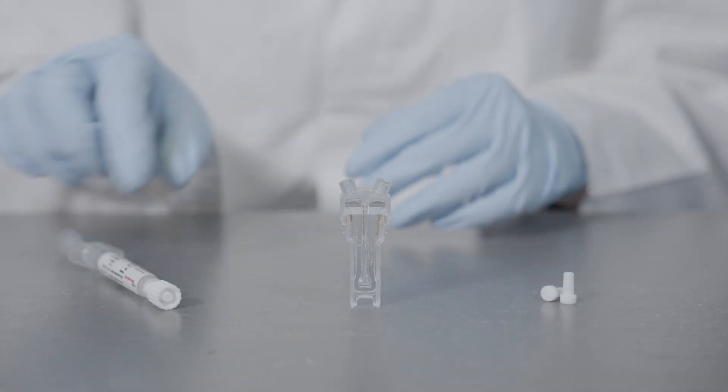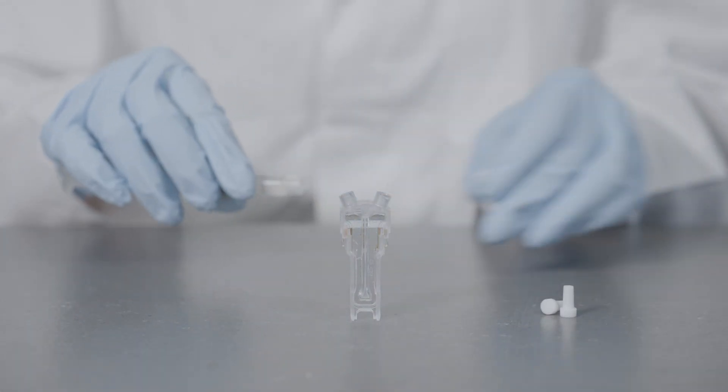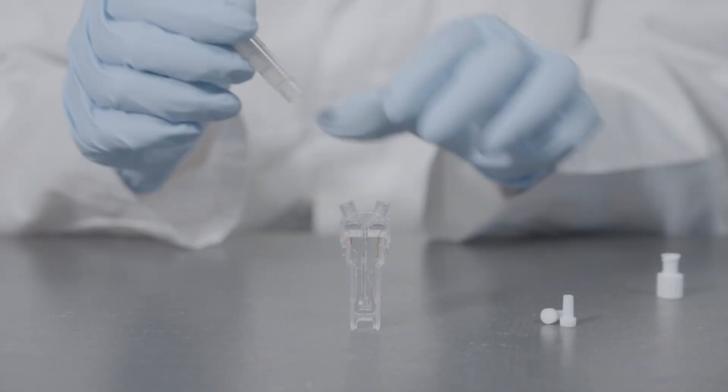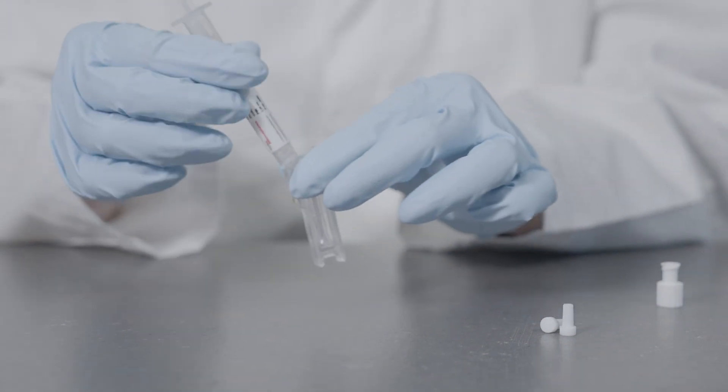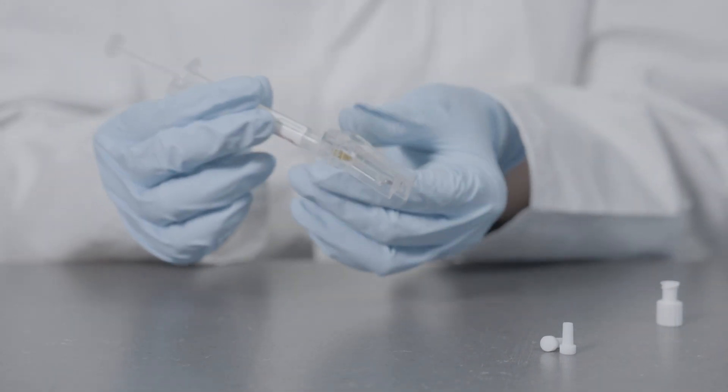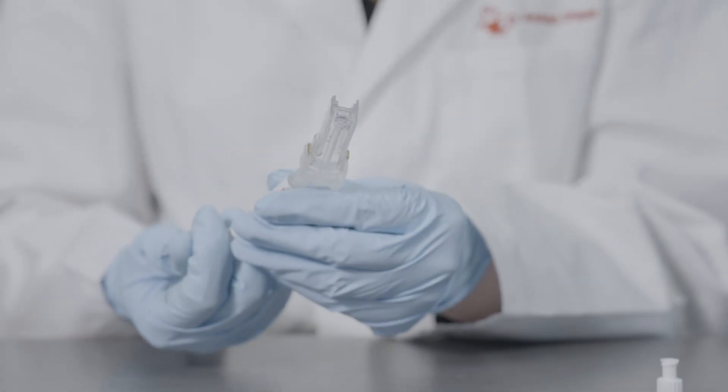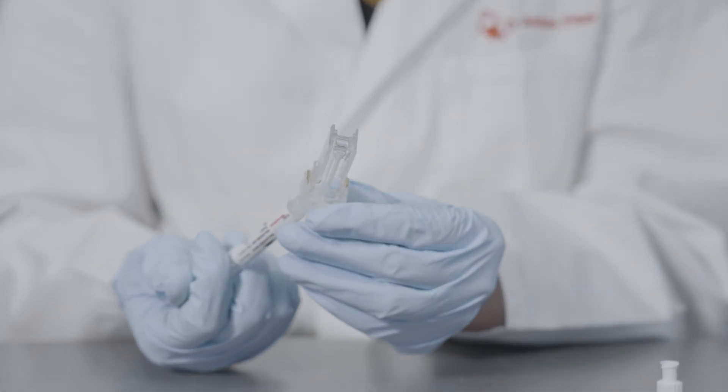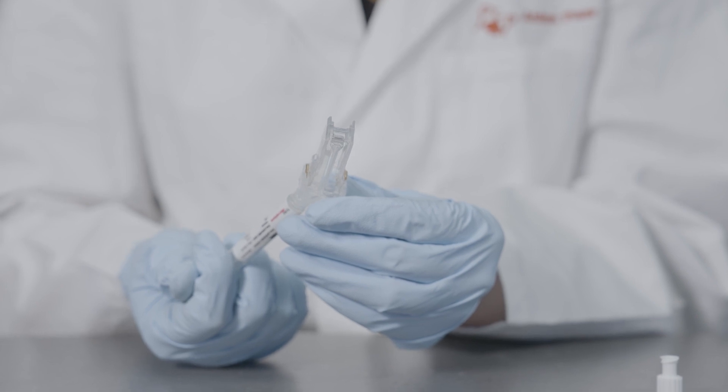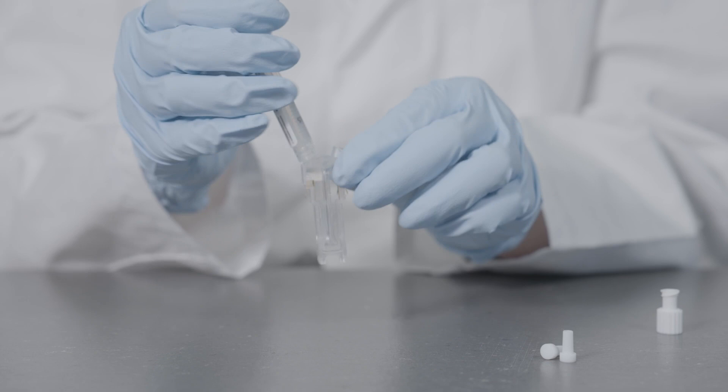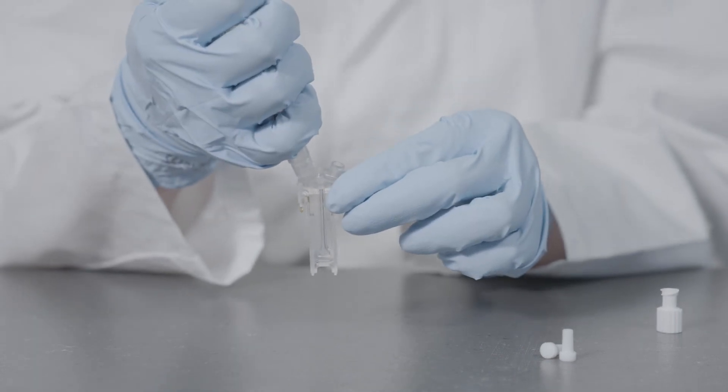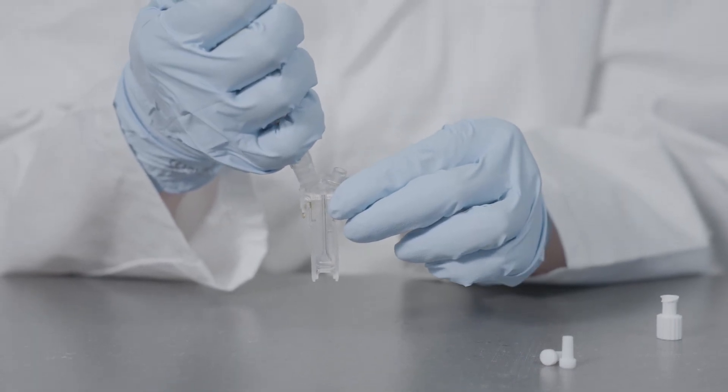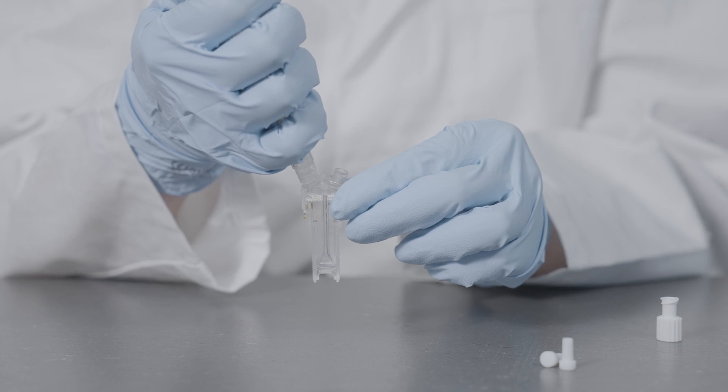Next up for the DLS 501 and 701 is the measurement of electrophoretic light scattering. For aqueous samples, fill the omega cuvette with the sample and condition it for a minute. Discard the first sample and refill the cuvette. Carefully examine the cuvette for air bubbles. Remove small bubbles by gently tapping the cuvette on the bench repeatedly.